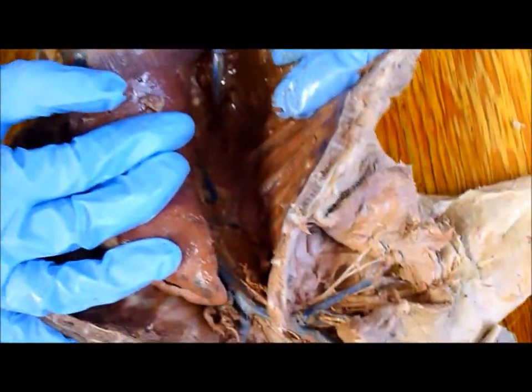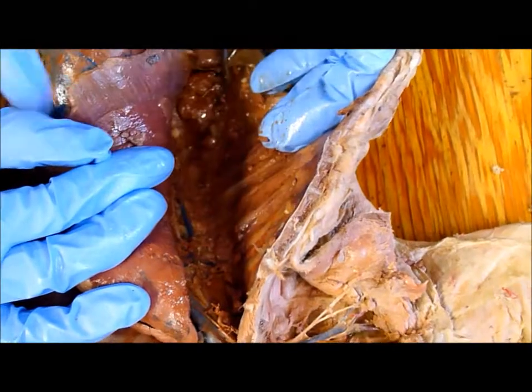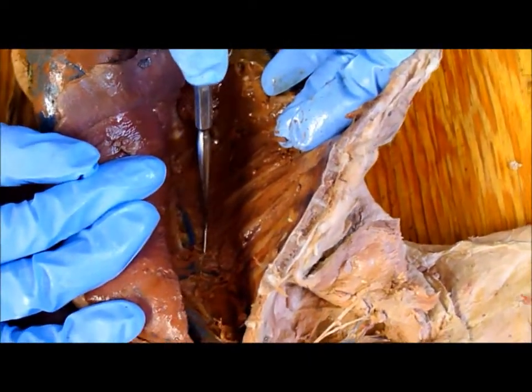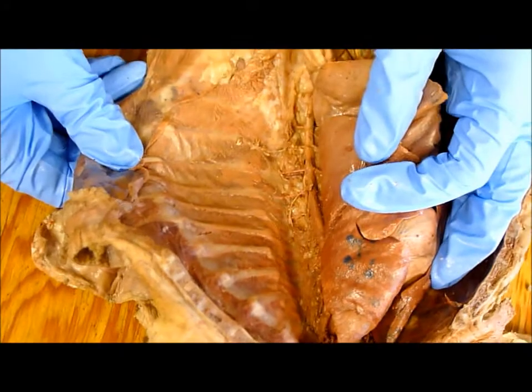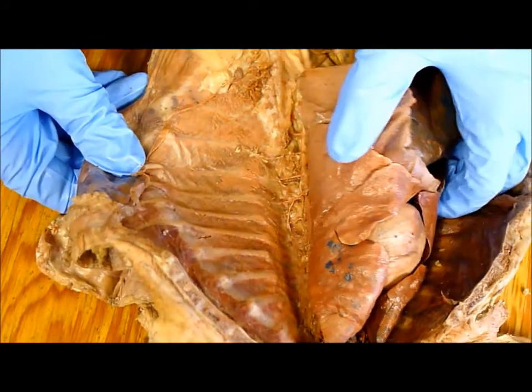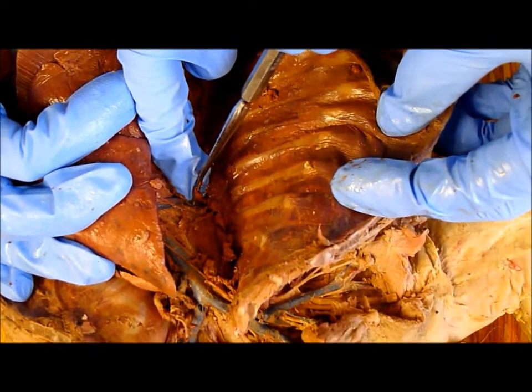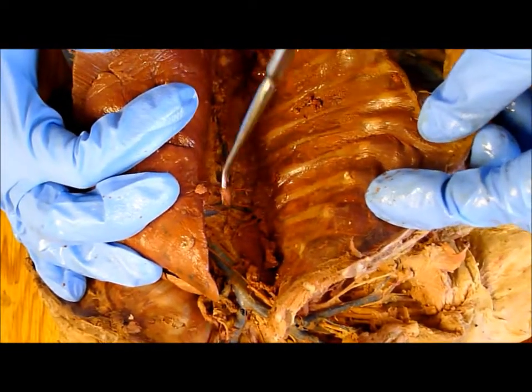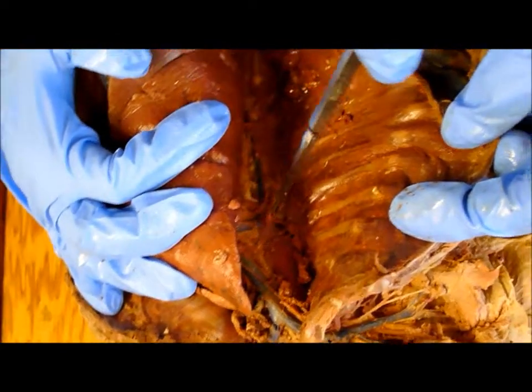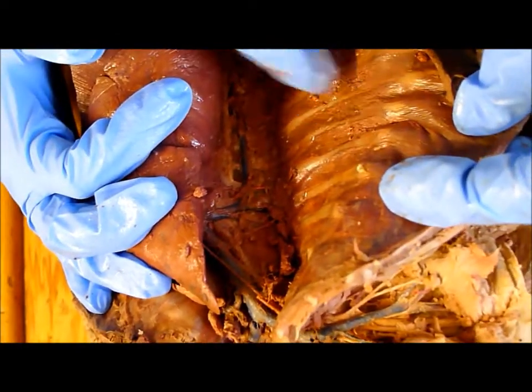That's the azygos, and then the blue ones in there are the intercostals — the intercostal veins. And the red ones too, those are the intercostal arteries, which run between the ribs. On the other side you can see the intercostal veins — the blue ones right there. The azygos comes off the heart, goes down, and drains the intercostals.